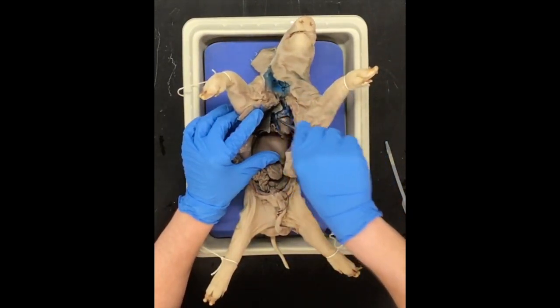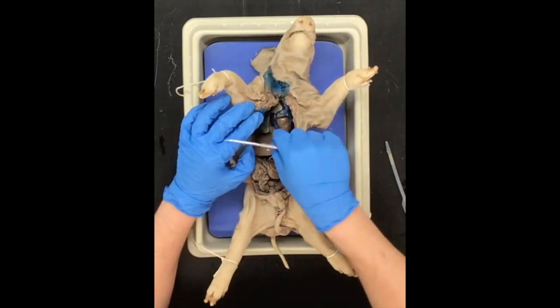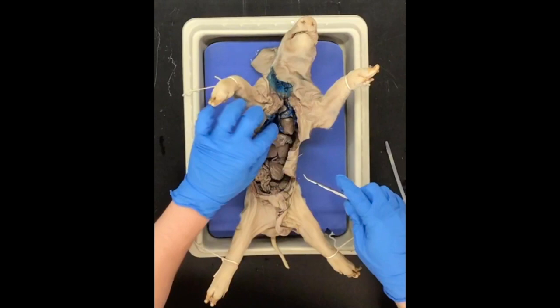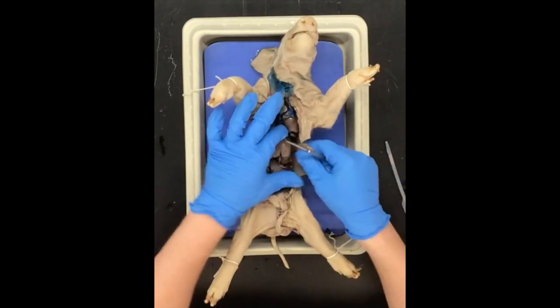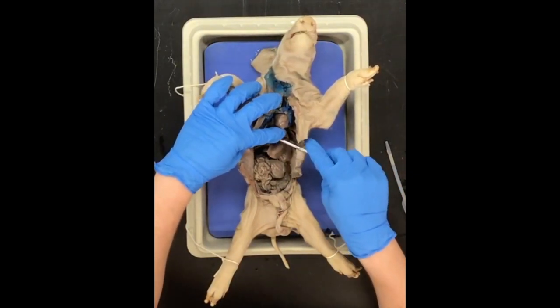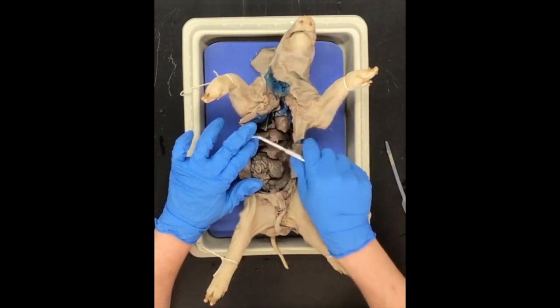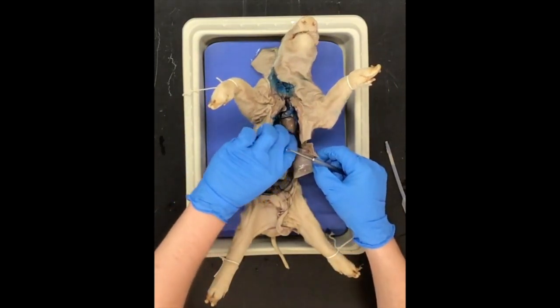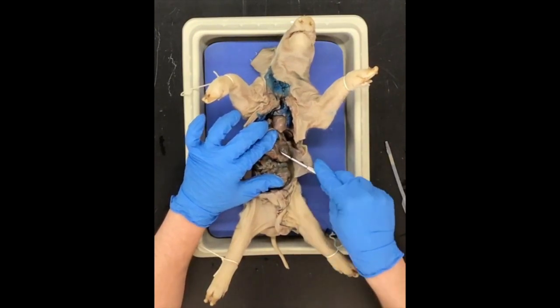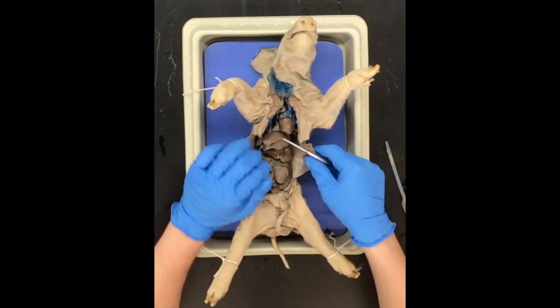So those are some of the major organs. We have the lungs — lobes of lungs on either side of the heart — right in the center of the chest. We have this flap, which is the diaphragm, separating our chest cavity from our abdominal cavity. Right underneath the diaphragm, we have the liver. Underneath the liver, pretty much connected to it in the pig, we have the gallbladder. And then underneath the liver, kind of to the upper right-hand side of our abdominal cavity, we have the stomach. The stomach feeds into the small intestine, and then the small intestine feeds into the large intestine.